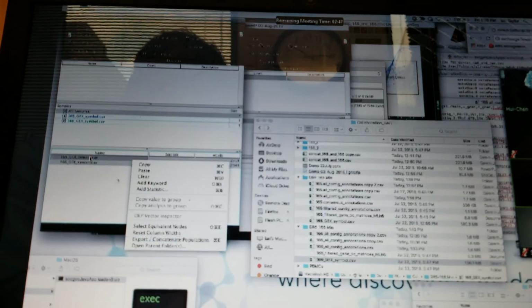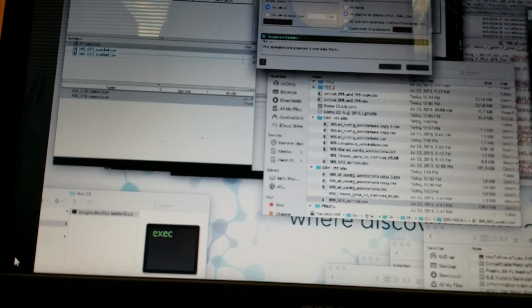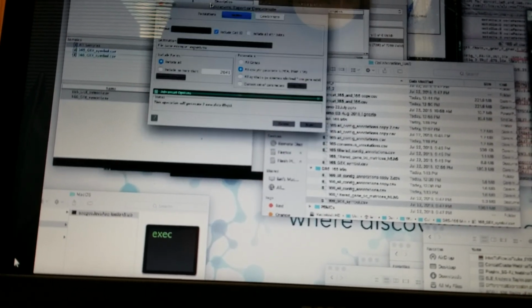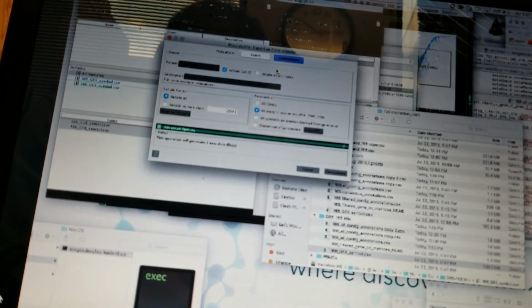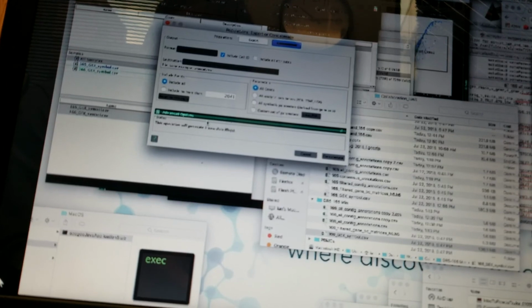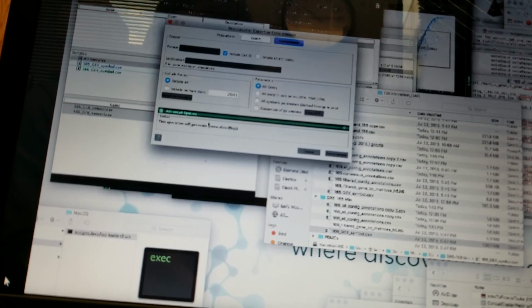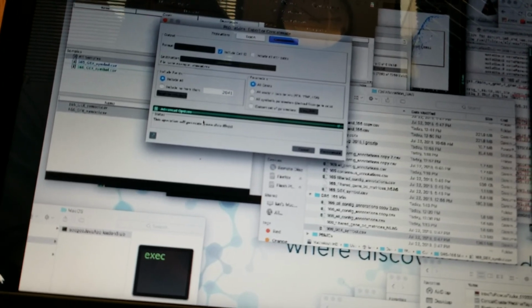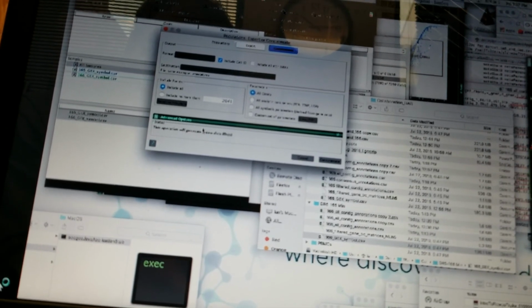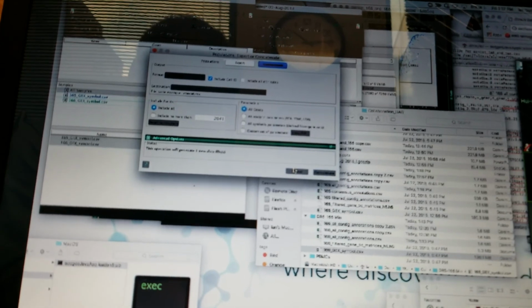Right. So if you right-click on a selected set of populations or samples, you can choose Export Concatenate. It opens up this window. And if you concatenate, then you can combine all of the genes for all of the cells into one data file. That's all that I did. Is it going to remember if it's 165, 166? It's not going to remember, except that it's going to contain a sample ID parameter, which I'll show you next.